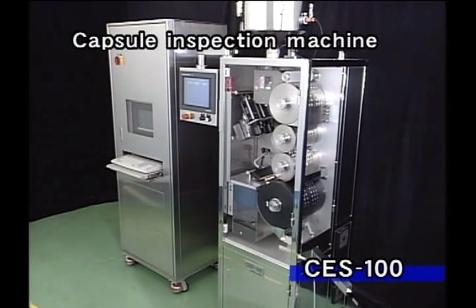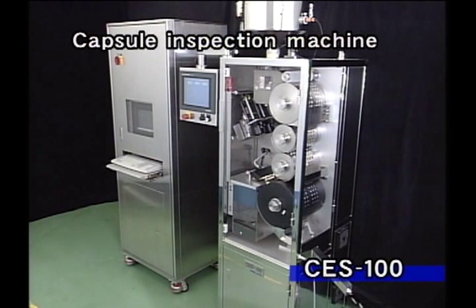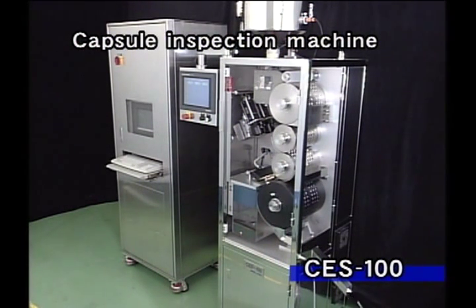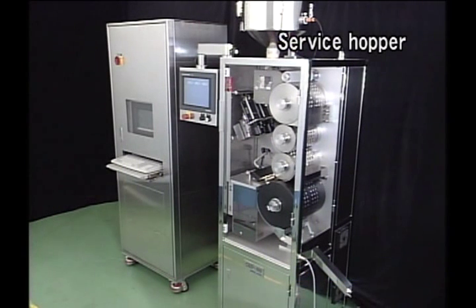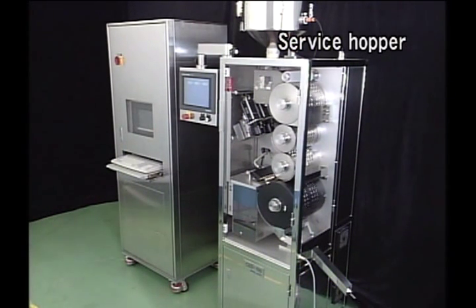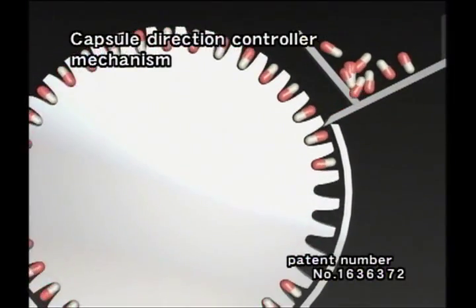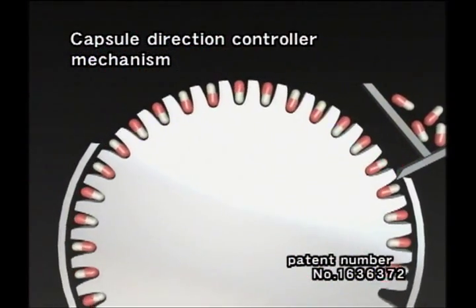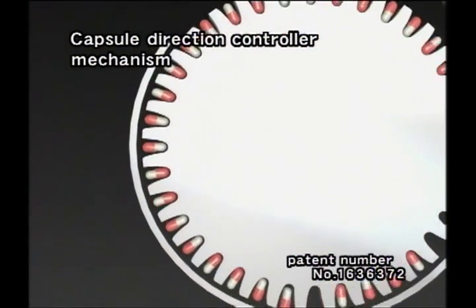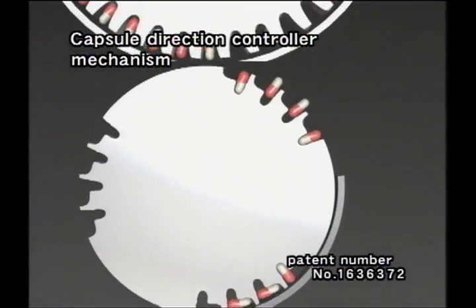The CES-100 was developed in order to increase the quality of drug products. This machine will rectify capsules when the caps and bodies are not in the same direction through the process of transportation by three rollers. Using the difference in diameter between the cap and body, correct rectification is performed. We can transport capsules that are filled without applying any pressure to them.